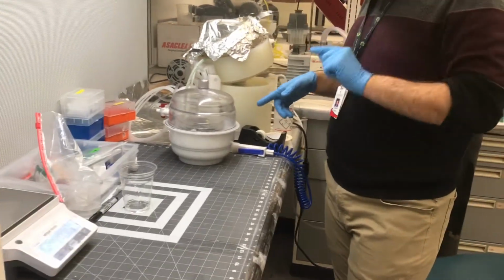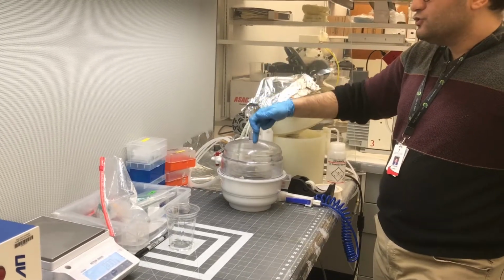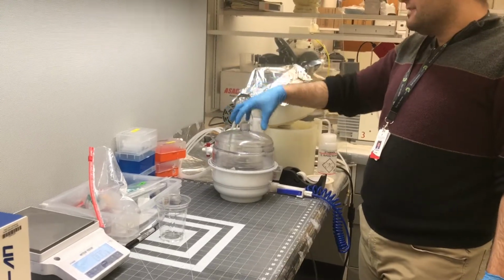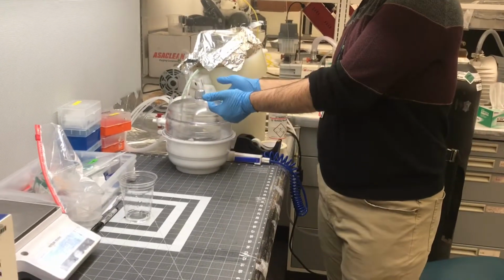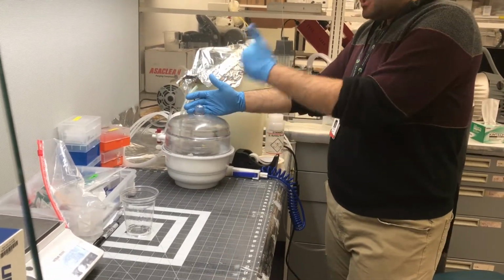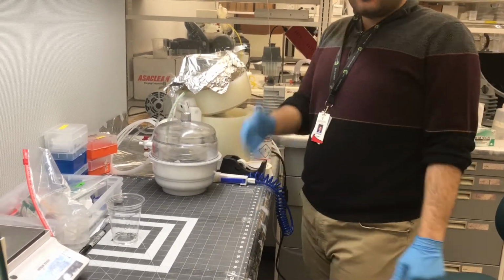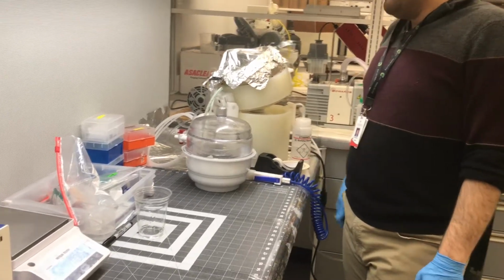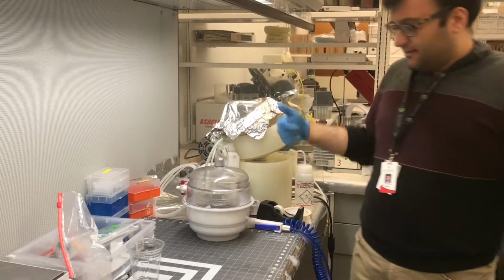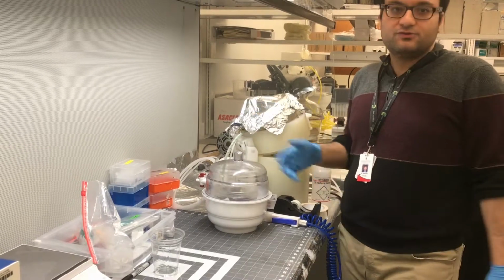You should also pay attention to this point: you should not keep the PDMS with the chip inside the vacuum for too much time. Otherwise, instead of curing with heat, it cures with the pressure, which is not good. It makes a semi-solid, meaning some part of the solidification happens during this time and some part in the oven, which is not good. How long do you usually keep it here? Again, the timing depends on the area of the chip, but normally for those chips it takes 10 to 15 minutes to remove all the bubbles.